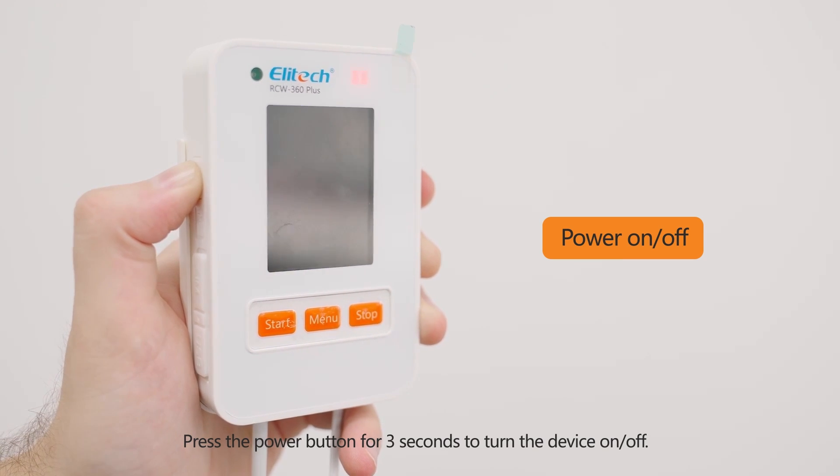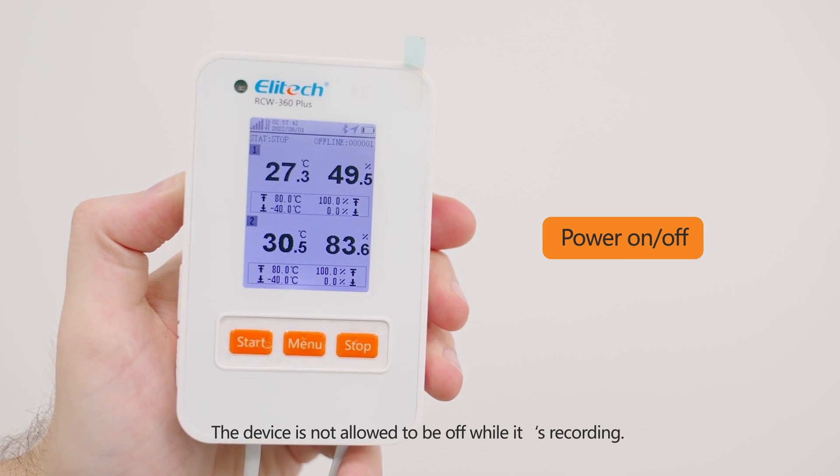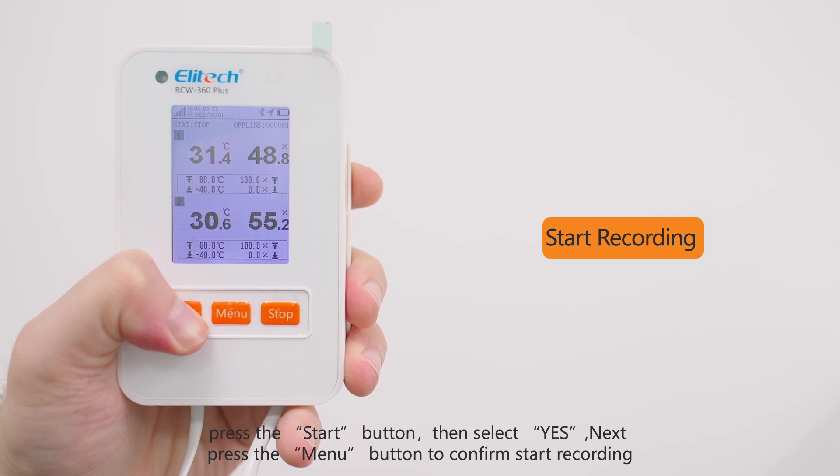Press the power button for 3 seconds to turn the device on and off. The device is not allowed to be off while it's recording.